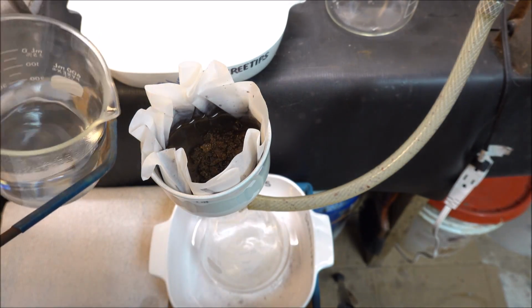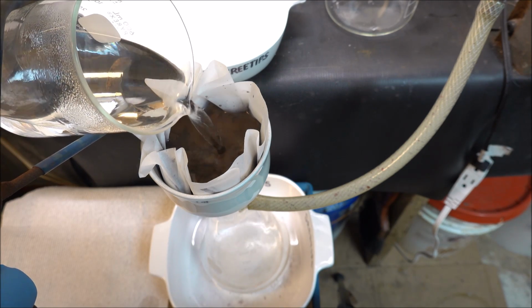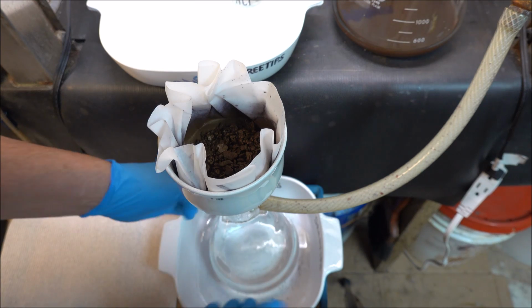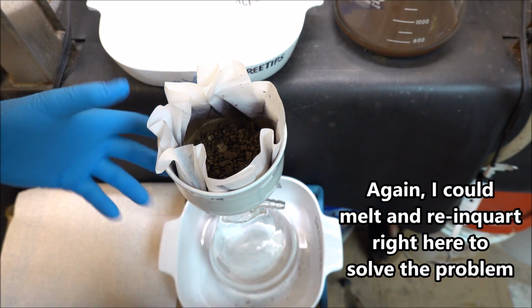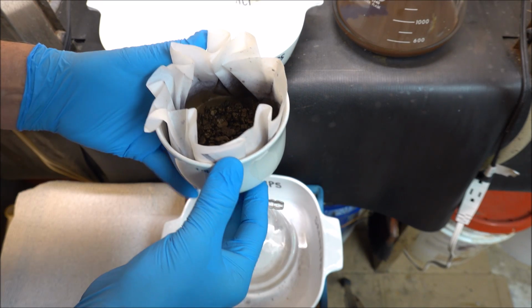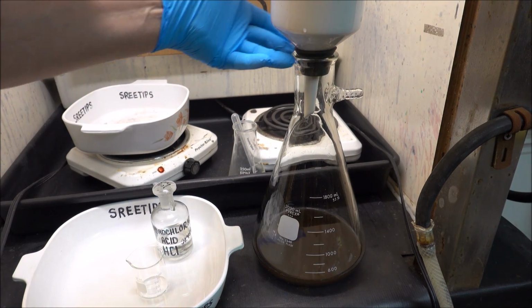Distilled water here going in. Try to get all that silver rinsed off of this gold. All right, I got a clear solution down here. Hot distilled water. And what I'm going to do now is take this funnel off. Set it up here on this large flask. Just get it out of the way.